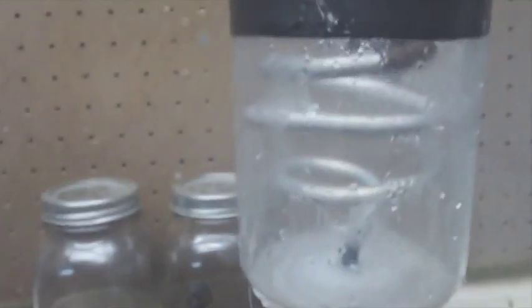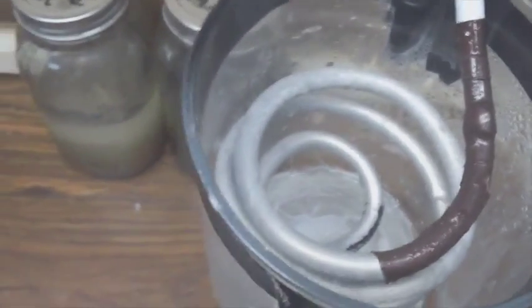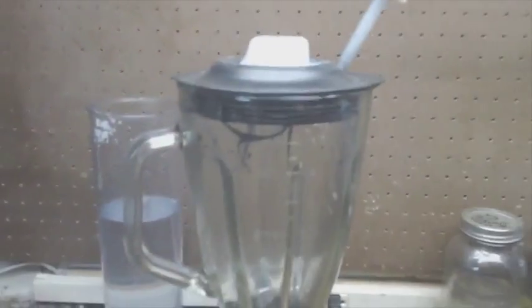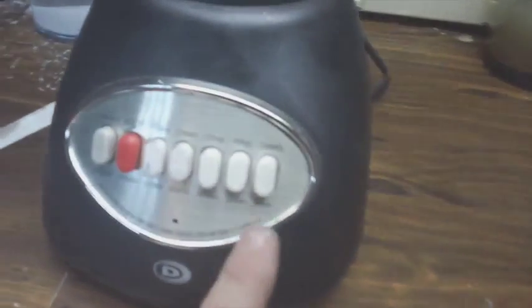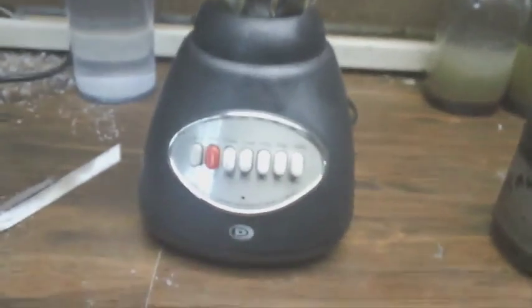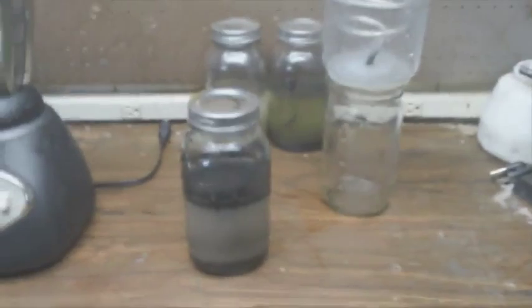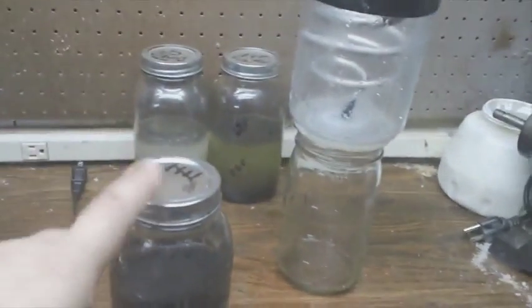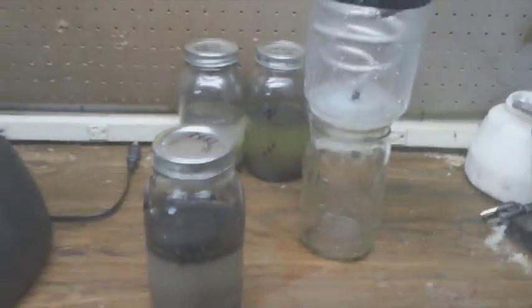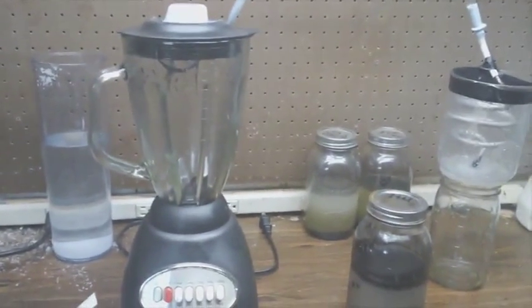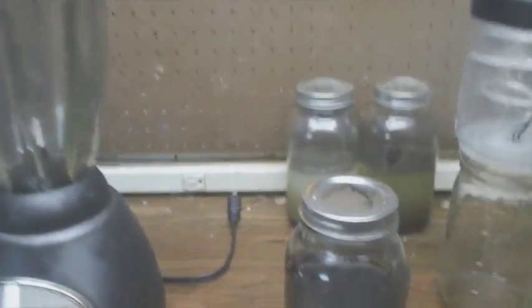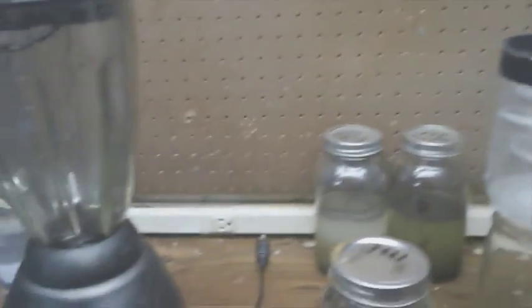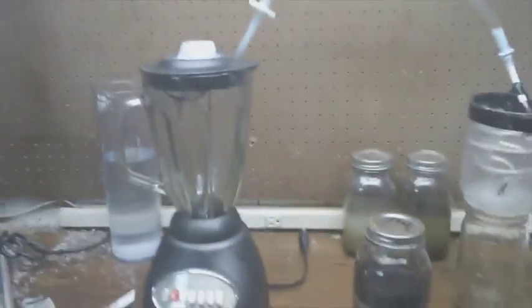That's a condenser with nothing in it - it couldn't be any simpler to build. This is a much better blender. It has liquefy that locks, so it doesn't have PVC. This lid fits tight. There is absolutely no smell of acetone - well, a little bit now because I just dumped that in there - but basically when it's running you cannot smell the acetone at all, which is perfect because I wanted to run it in the basement and not outside.